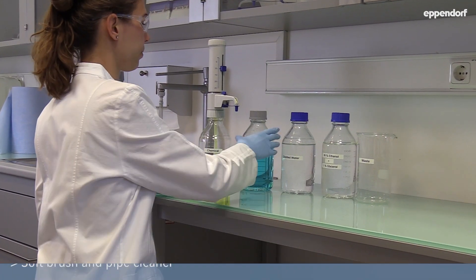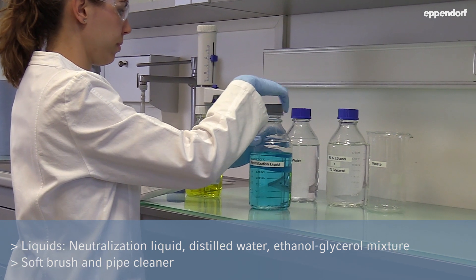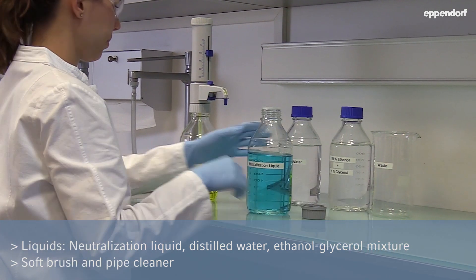We will need a bottle of neutralization liquid, distilled water, an ethanol-glycerol mixture, a soft brush and a pipe cleaner.